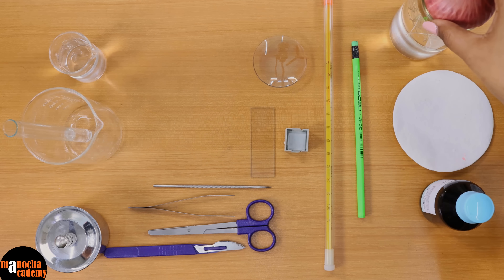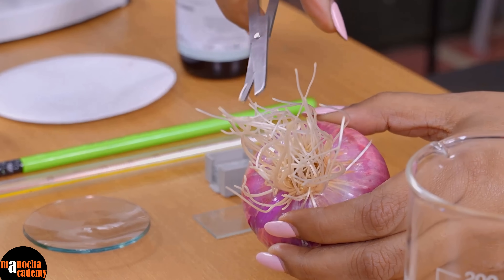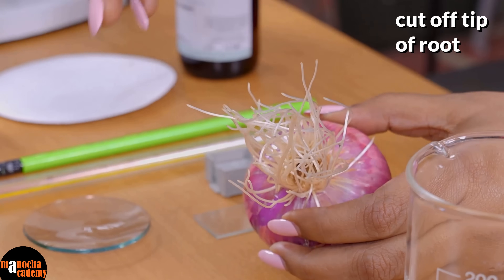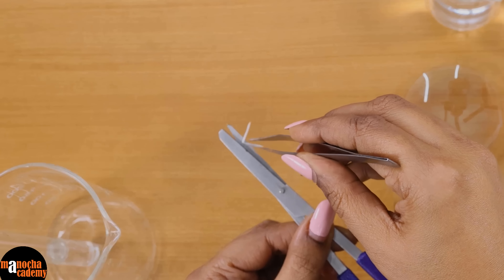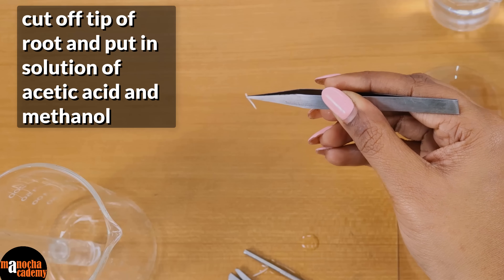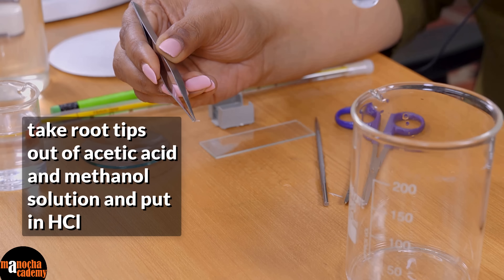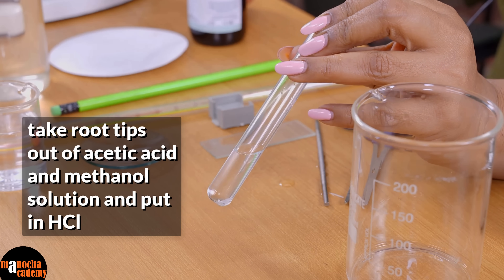Now what we will do is — and what I have already done — is that we will take these root tips. We will take the root and take the absolute tip of it. If you look at the tip, it becomes slightly pointed. We have taken about this much of the root tip, and I will put it in a solution containing acetic acid and methanol, and then after that in hydrochloric acid.